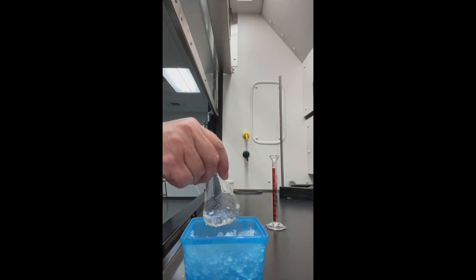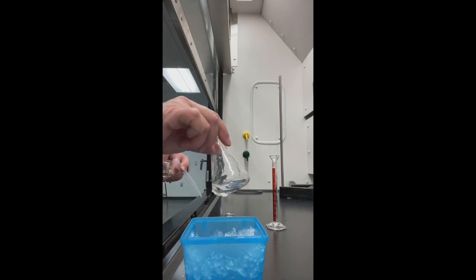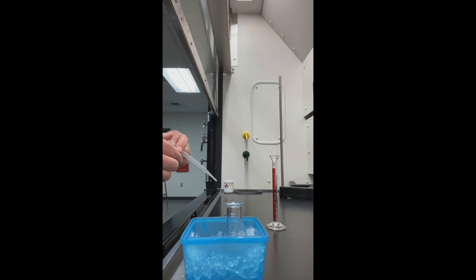Now that I have my seven mls of sulfuric acid nice and cold, I'm going to add dropwise my methyl benzoate. I noticed when I open the bottle and dispense it, it has kind of an interesting odor, maybe a little bit of wintergreen.